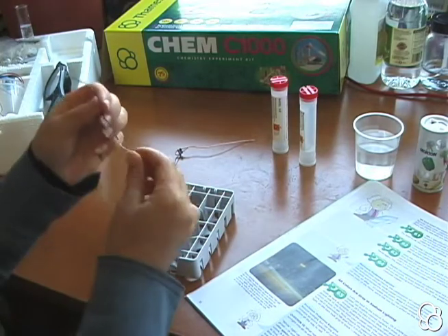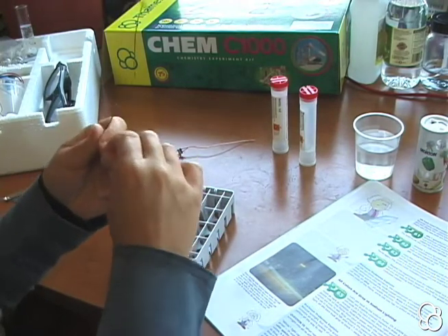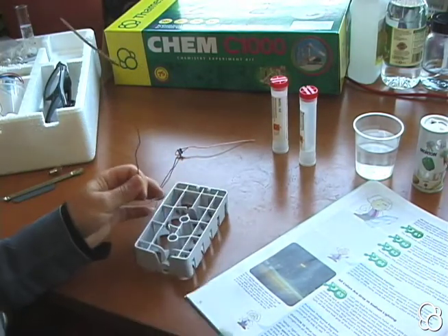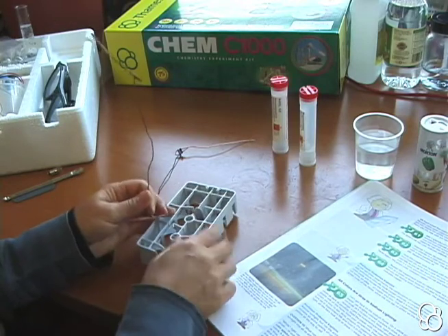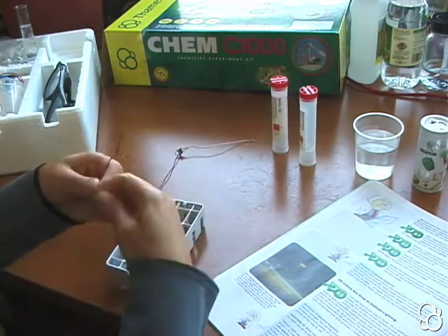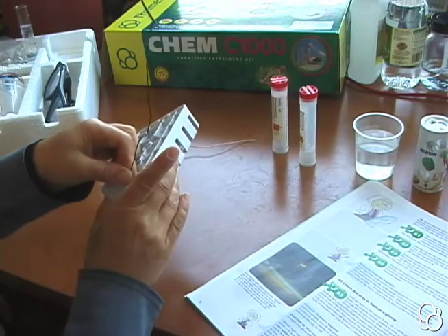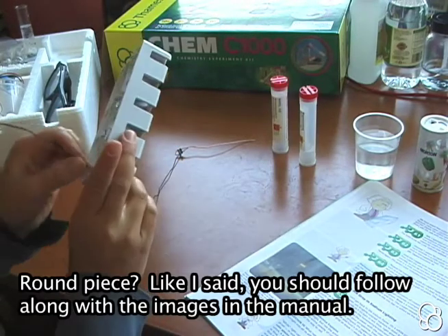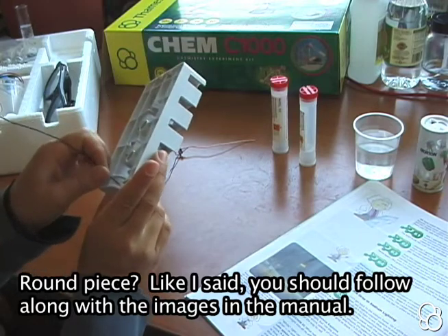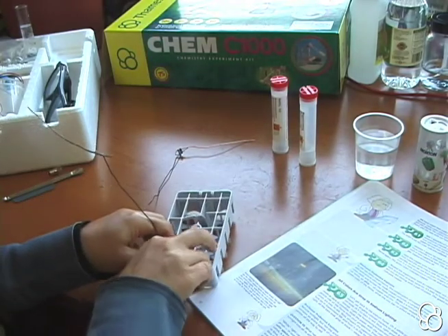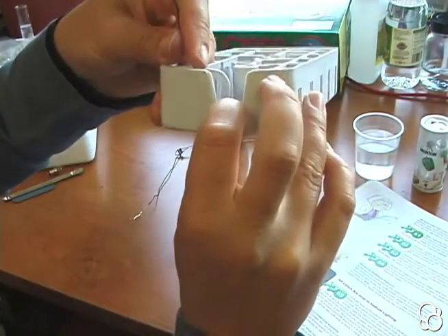So you take this—this is going to be kind of small, so I suggest you look at the images on page 33. You're going to take the wire, put it into one of the holes here on this round piece, then through the other hole, and then fold it back on itself. You can see the wire in here.